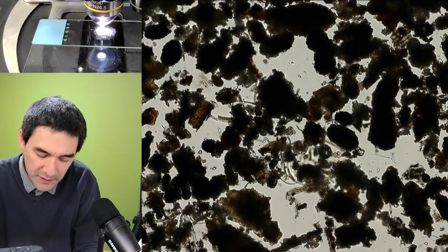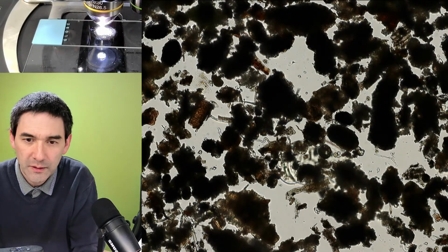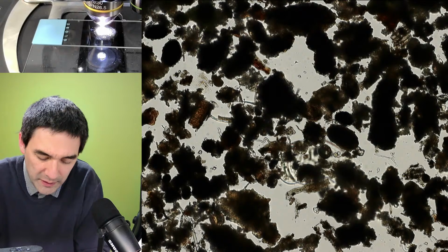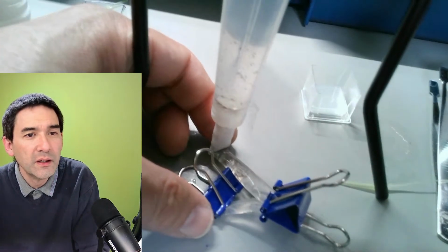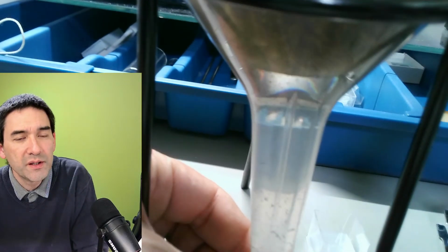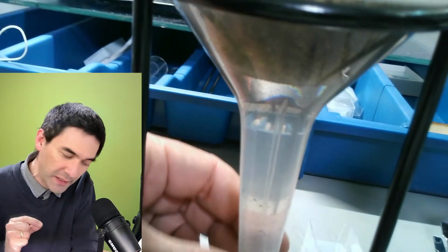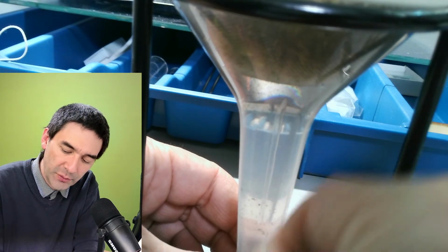Well, I would actually propose a couple of changes to the system that I have here. Basically what I have is the following. I have to change to the desk view. Okay, yeah. So if you want to do something like this, I propose a couple of changes here. First of all, I think the funnel is too long. This has to be shorter, and it would be nice to somehow have a system here where I could actually turn it so that I'm able to let down some of the liquid.